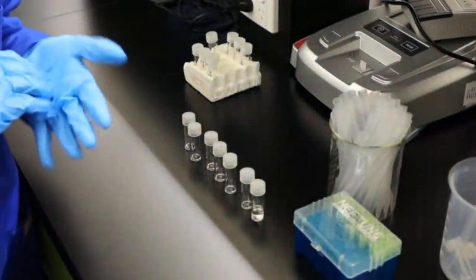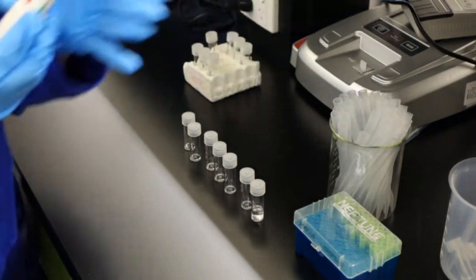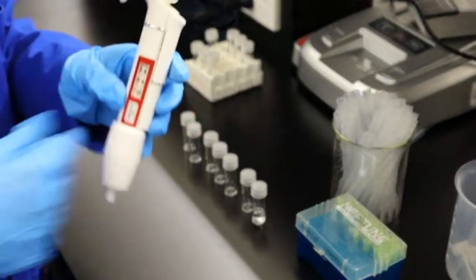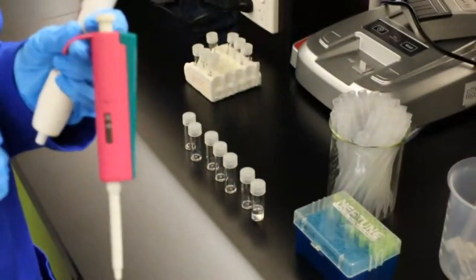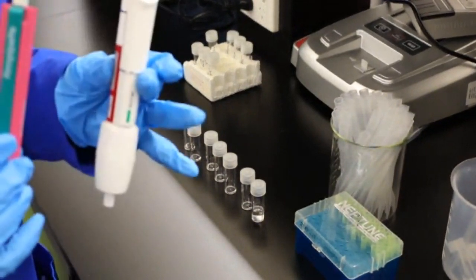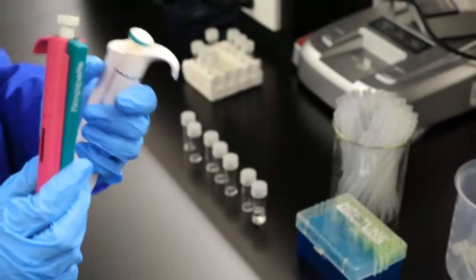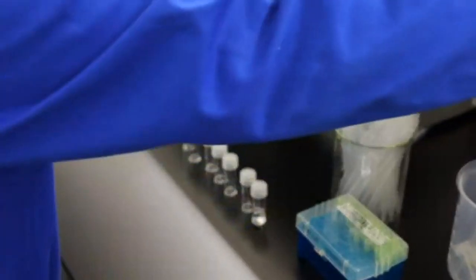But for us with the HPLC, we will be using smaller volumes. So we'll be using one of these. This here is a micro pipette. Has anyone used a micro pipette before? Raise your hands if you have. If you do biology, you may have to use them in there, but you do use them in chemistry as well. Oh, good work, Jeremy. And ET, well done. Okay, so that's all right. I'll show you how to use these first then.